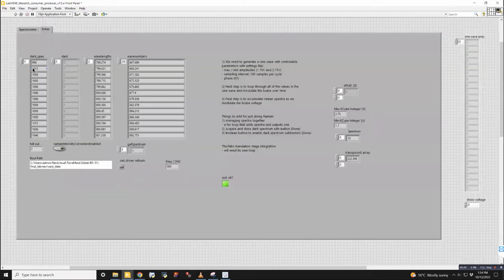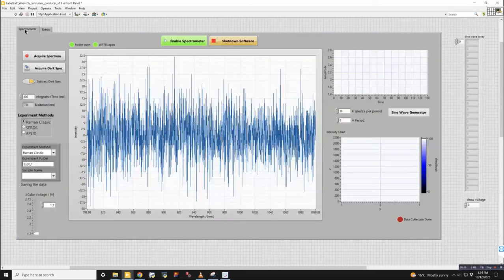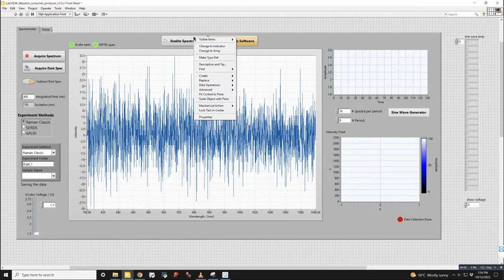And if you want something to be a certain value when you initialize the software, for instance, I want this to be always disabled, what you can do is set it to the value when it's not running that you want it to be when it starts up. Then you right click it, go to data operations, and then make current value default, and then save it. I'm not going to do that because I think we're happy with the default values.